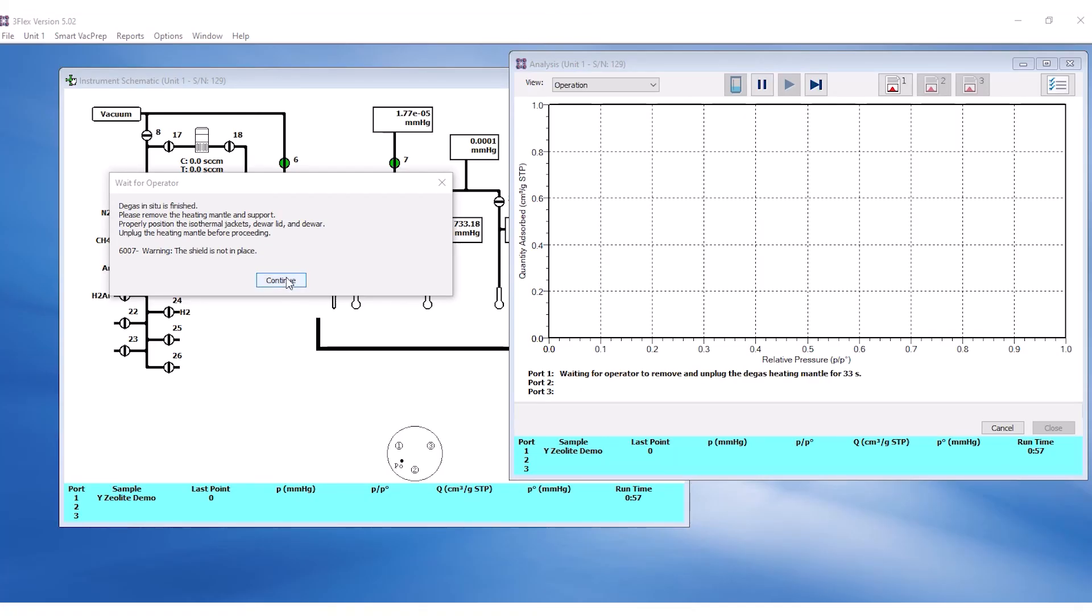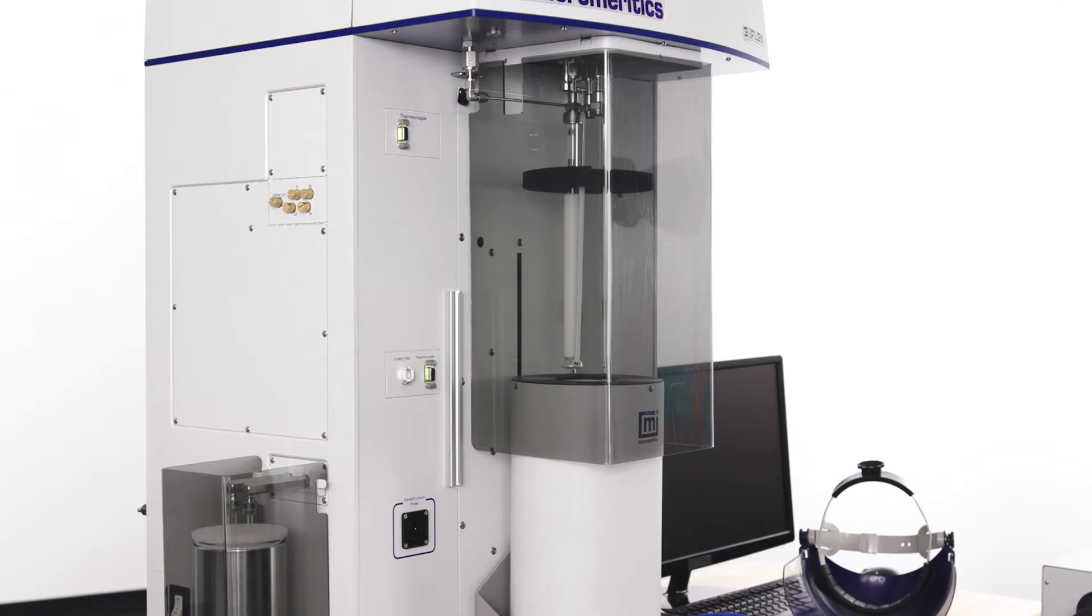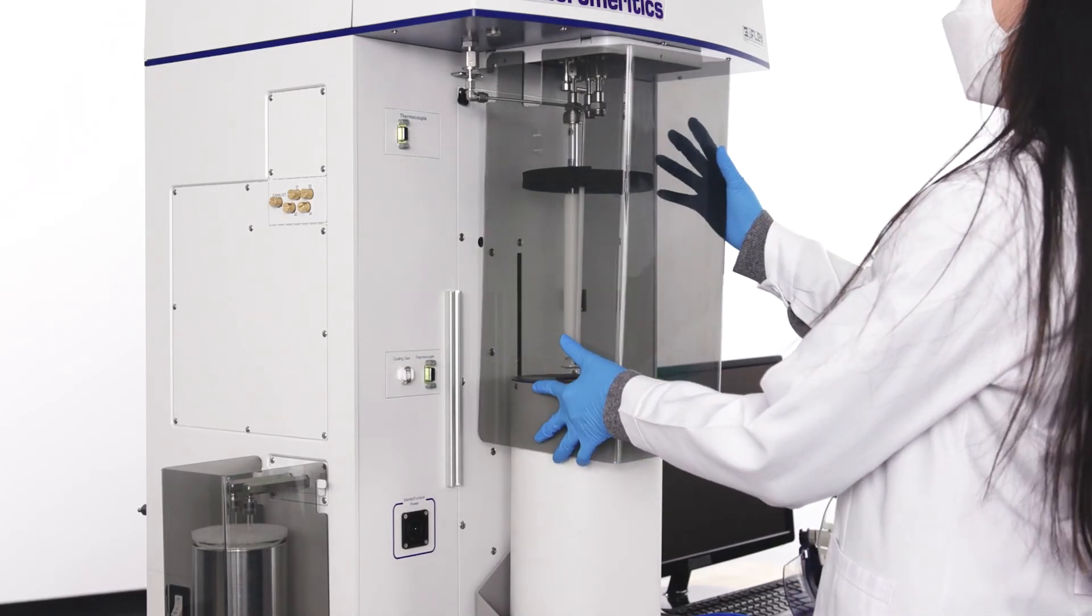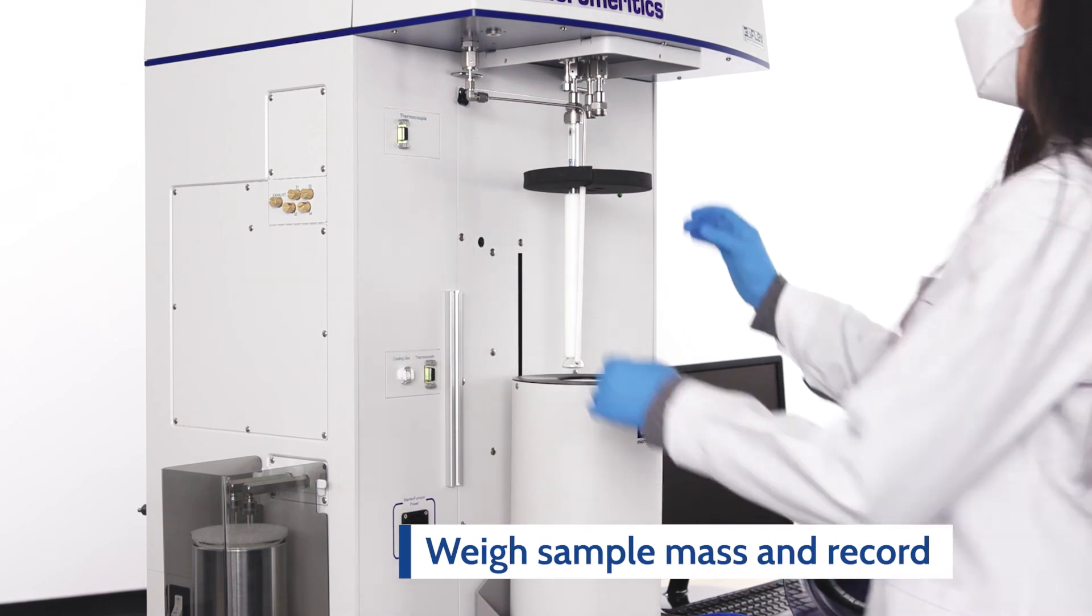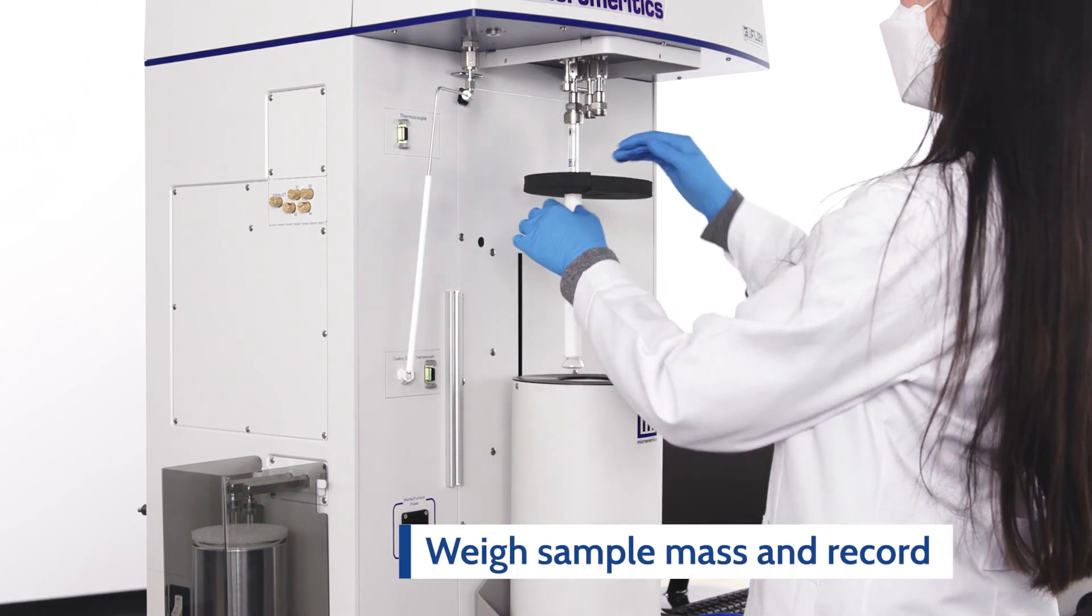Click Continue on the prompt to start analysis. Once the analysis is complete, unload the sample tube to weigh. Use this after analysis mass in the report.